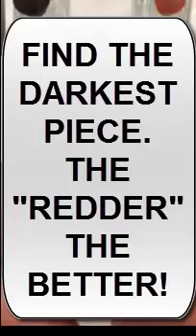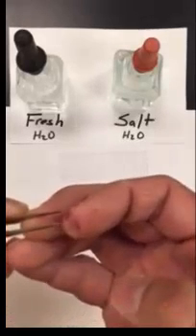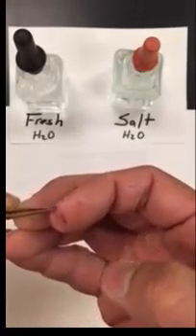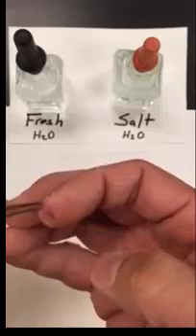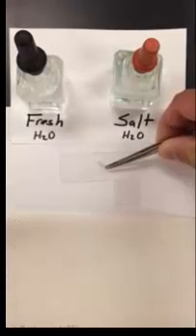All right so once you've done that just gently pull and you want to take a piece of that red onion skin and pull it off your onion. After you've done that you want to try to gently place it into your microscope slide. So I'm going to take this pair of forceps and carefully take this onion skin like that and place it in the water.